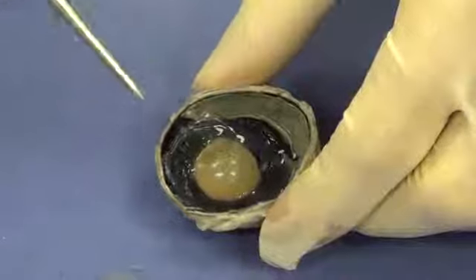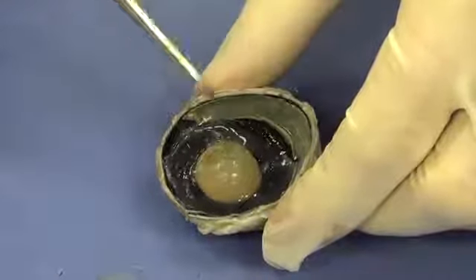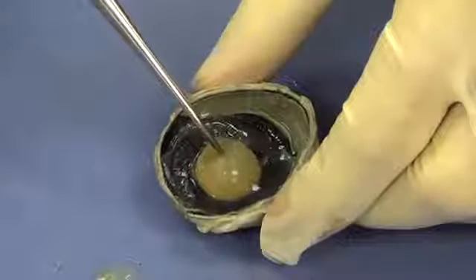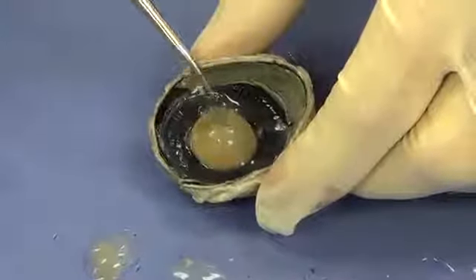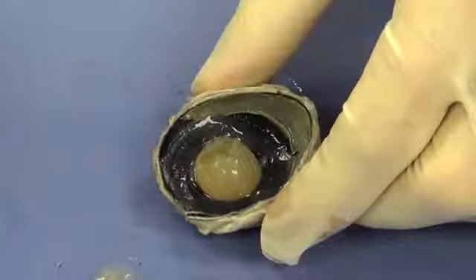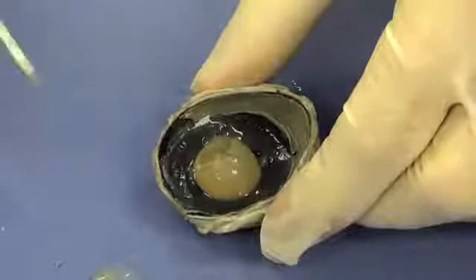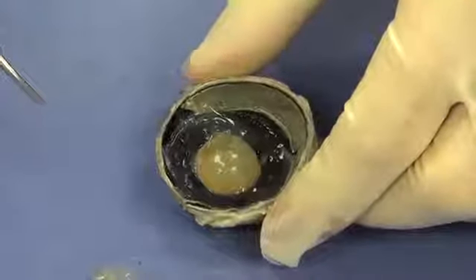Now, again, in a live cow, or you, this lens would be very clear, like glass. Now, this one's hard, but in a living organism, this lens would be very soft. You could actually squeeze it like you could a contact. Again, the preservative has denatured the proteins, made them cloudy, and made them very firm and rigid.